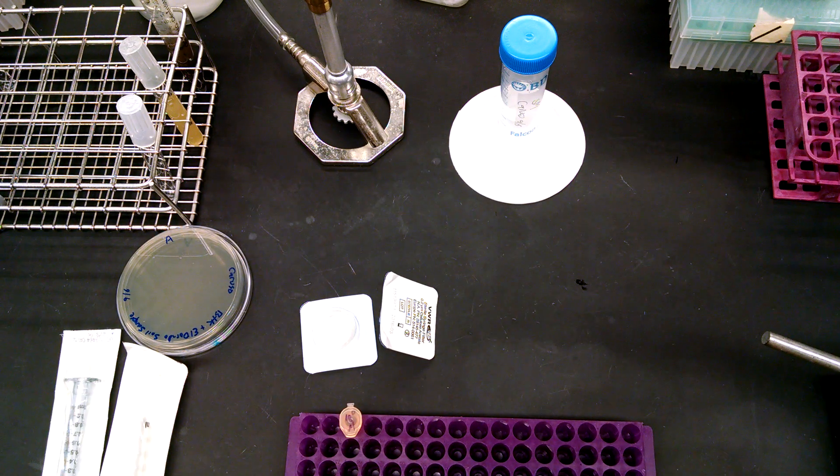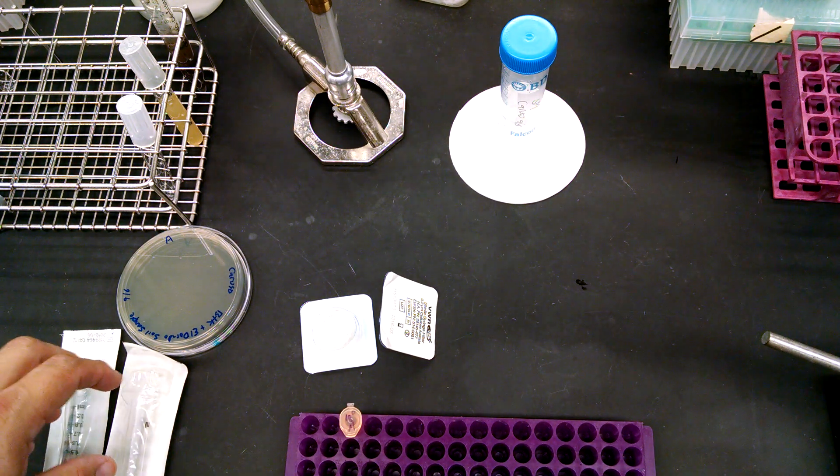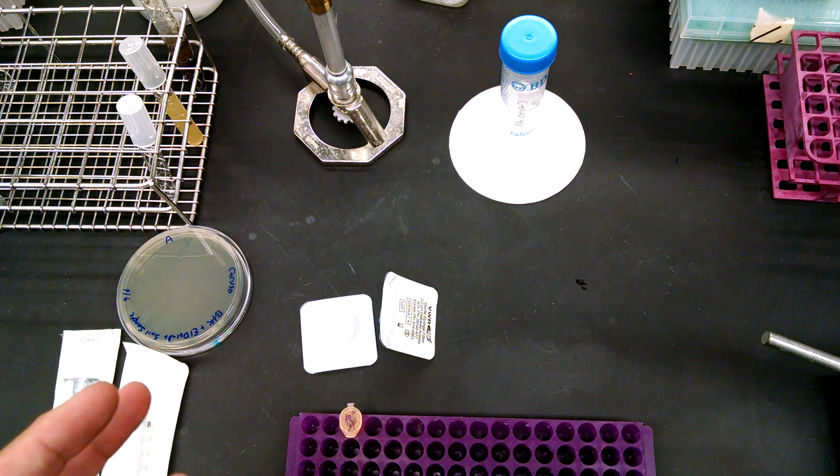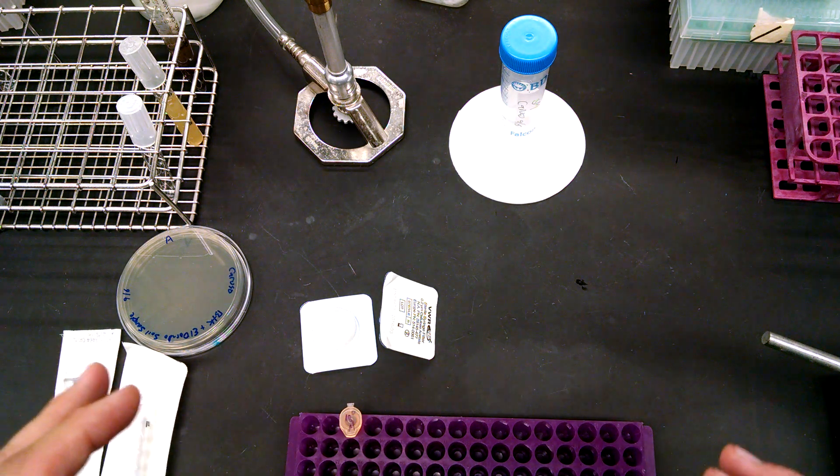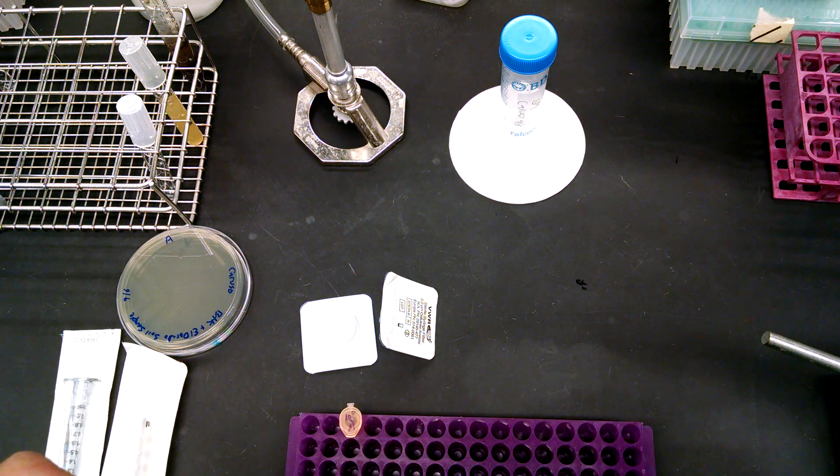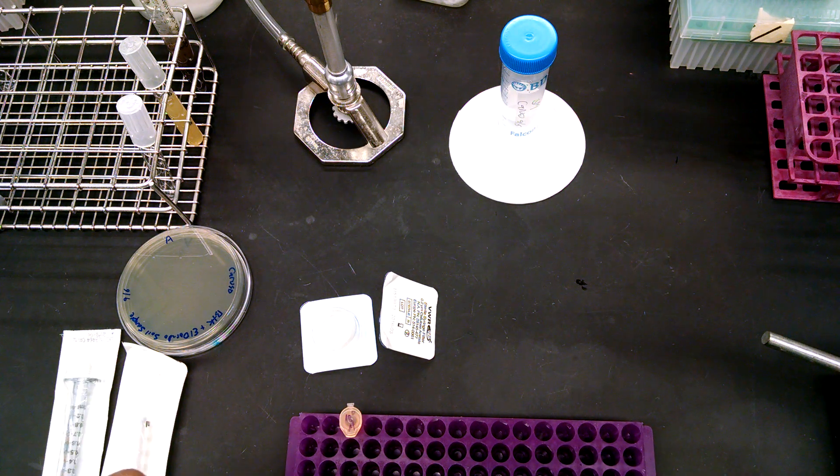This is a video for genetics lab phage hunters demonstrating how to use syringe filters to sterilize, well, anything, but in particular your soil samples for testing them at the very beginning of your phage hunting experiments.